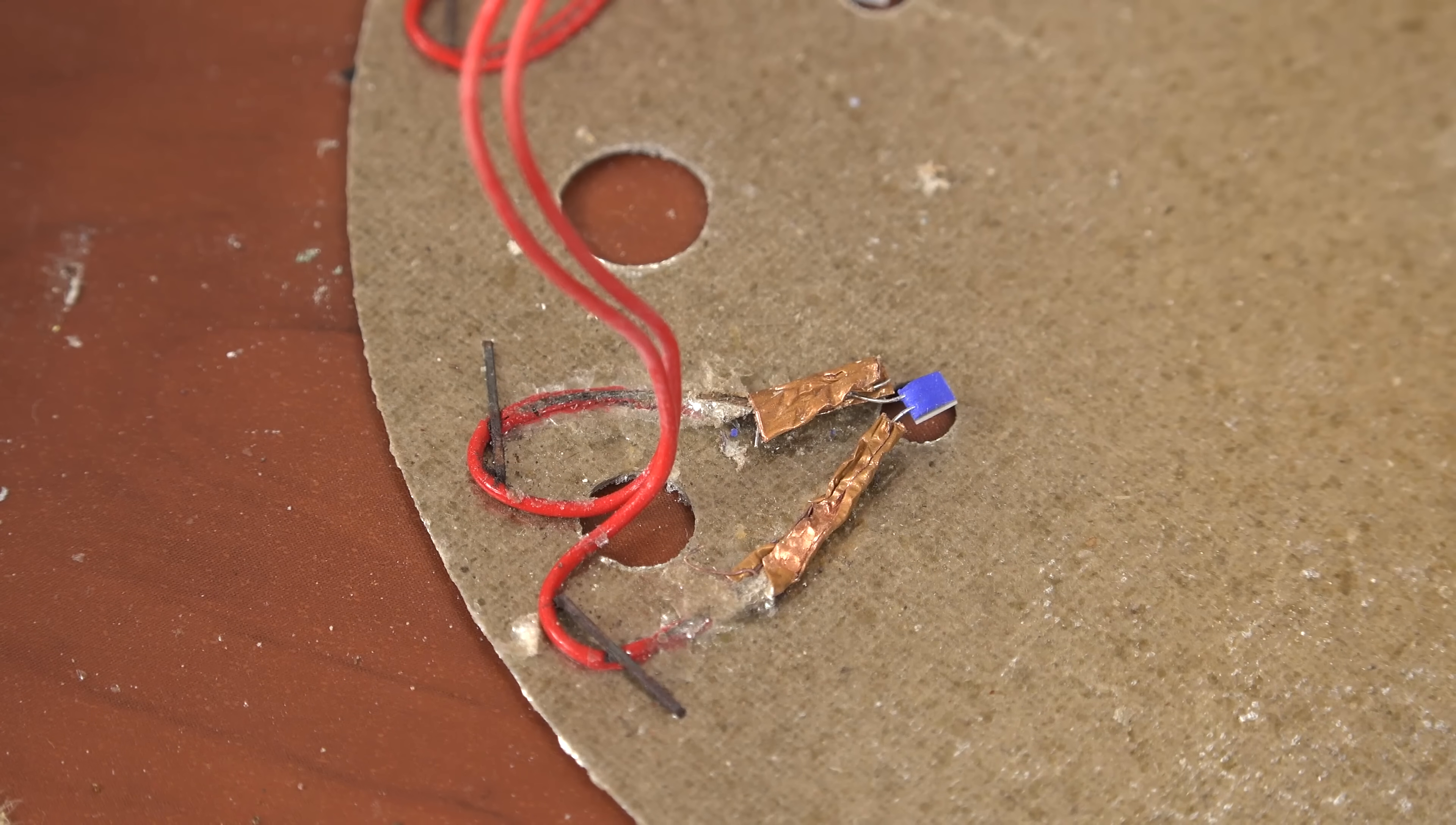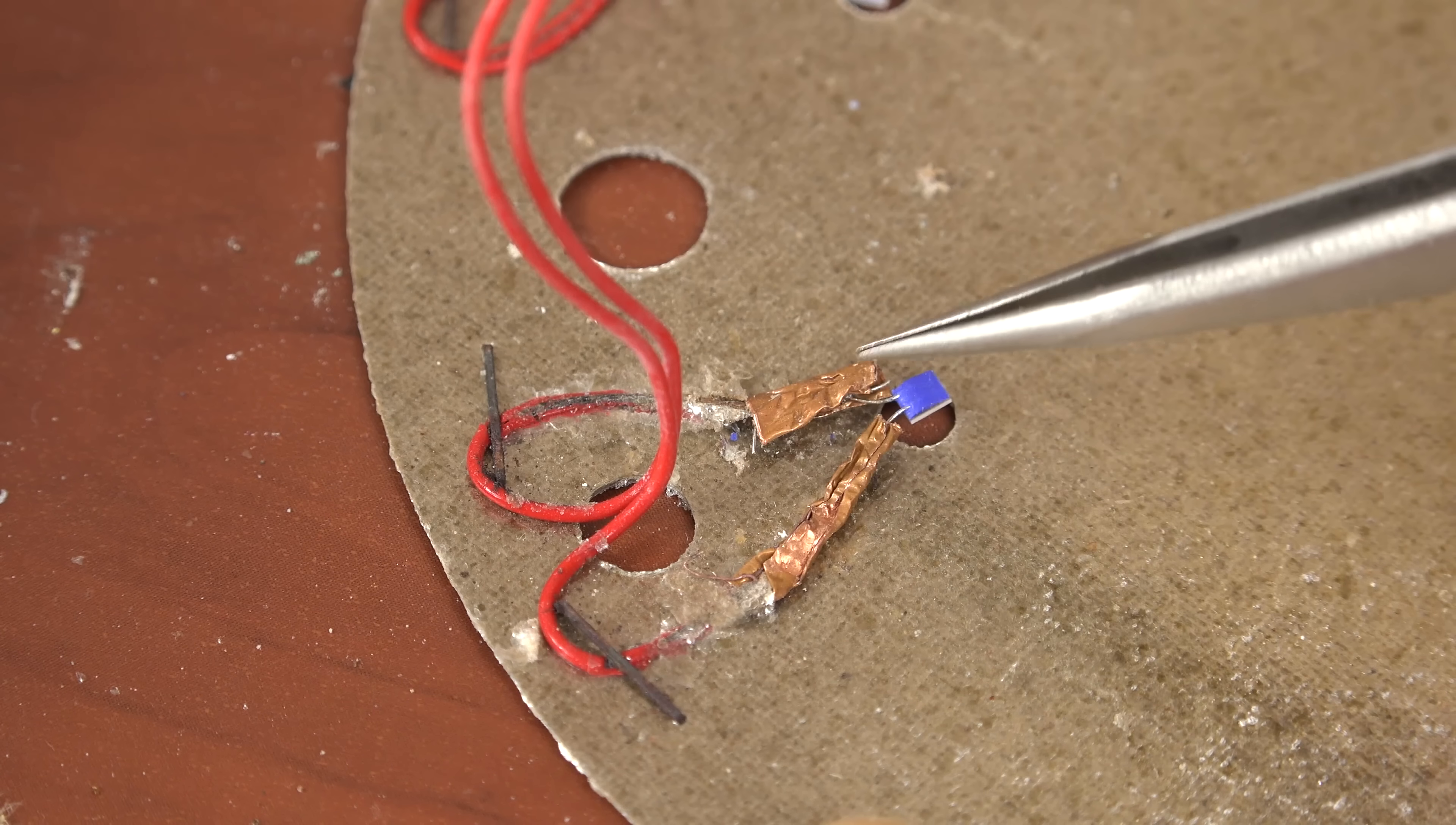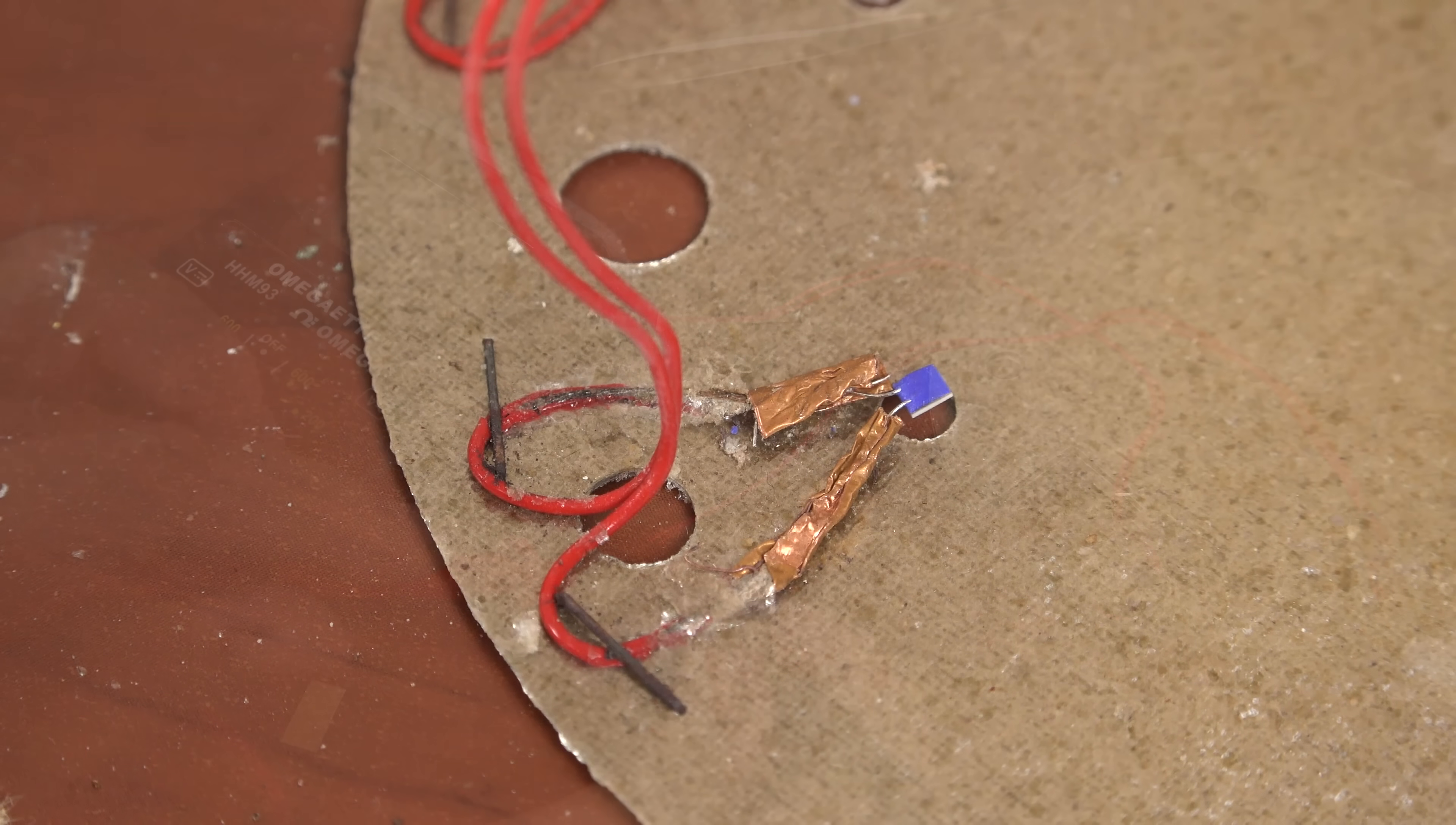And here we are. I've used copper foil to connect the leads because I can't use solder at these temperatures. Most solders would just melt again when the hot plate turns on. The previous leads were spot welded but I don't have that capability. Hopefully this foil fix will work and if it doesn't the sensors will fail open and the hot plate will turn off. So this won't fail to an unsafe condition and start a fire.